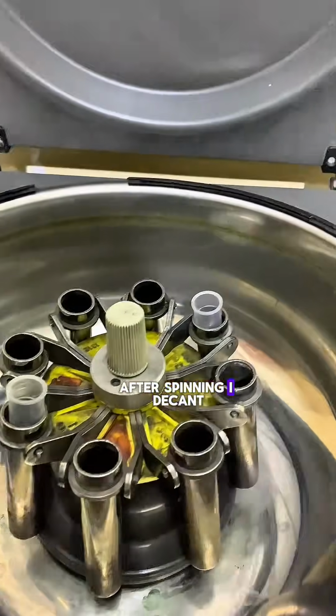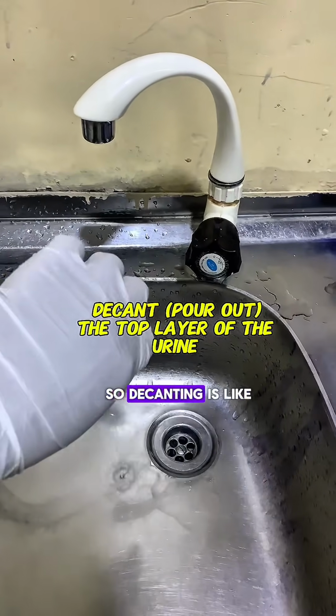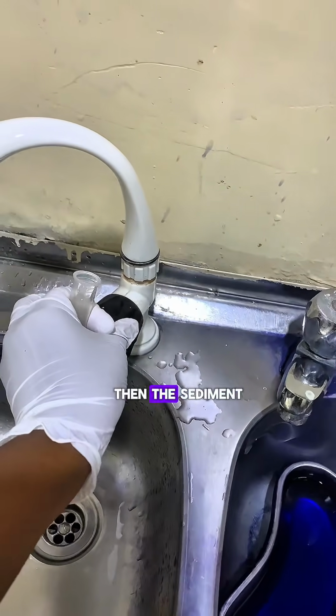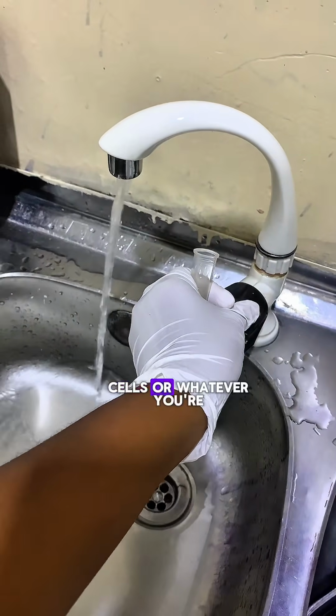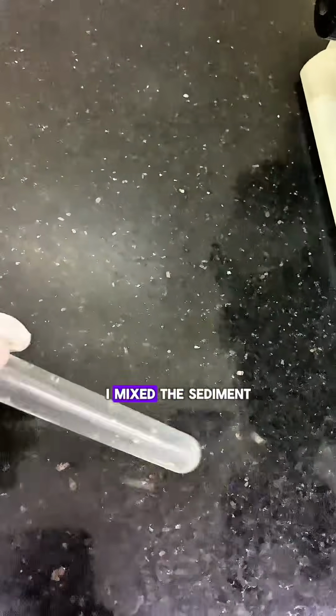After spinning, I decant the supernatant. The supernatant is the topmost layer of the urine. So decanting is like pouring it away. Then the sediment, that is the pus cells or whatever you're looking for, will be at the bottom of the centrifuge tube. I mixed the sediment.